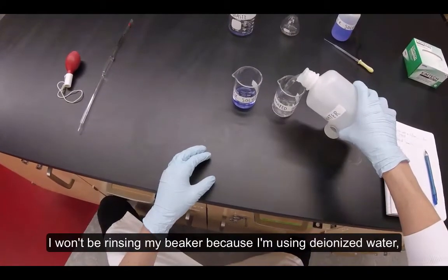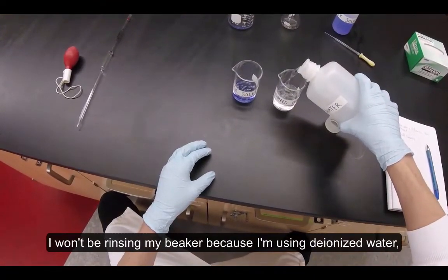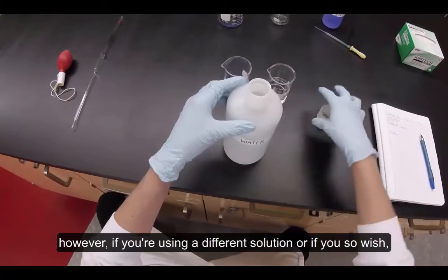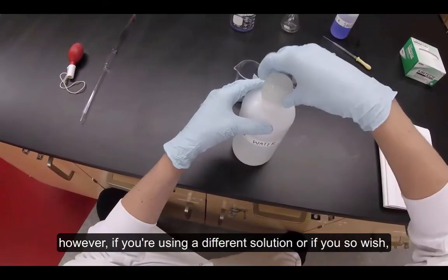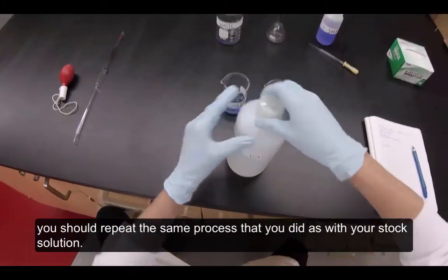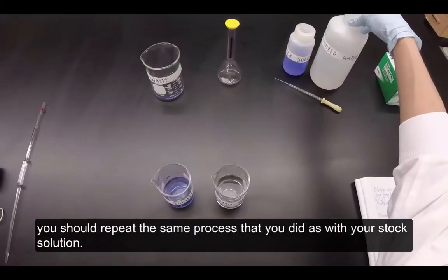I won't be rinsing my beaker because I'm using deionized water. However, if you're using a different solution or if you so wish, you should repeat the same rinsing process that you did with your stock solution.